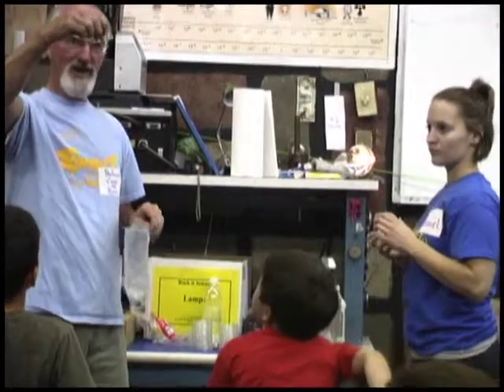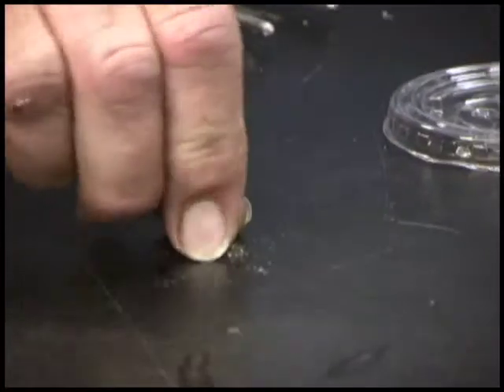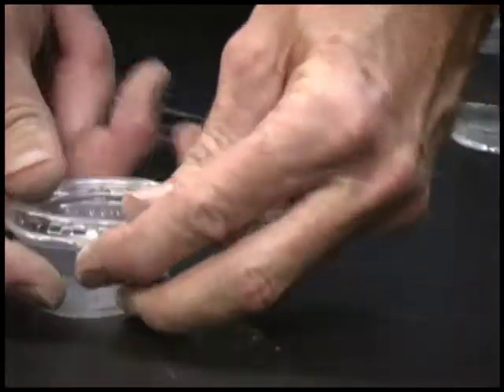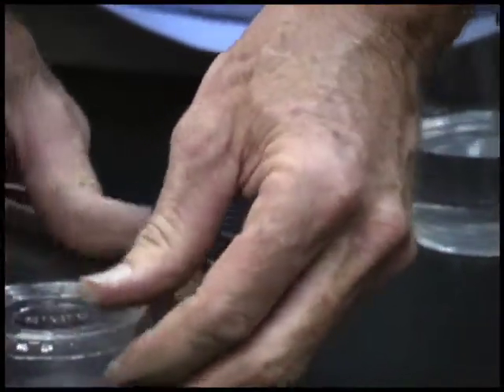We have a little jar of the crystals from a broken rock. There's some tiny rocks — you see the little pile of tiny rocks? It's always hard to tell how much to put in. I'm going to put the lid on. There's a hole in the lid — she noticed that. That's nice and tight. We're going to set that right there.